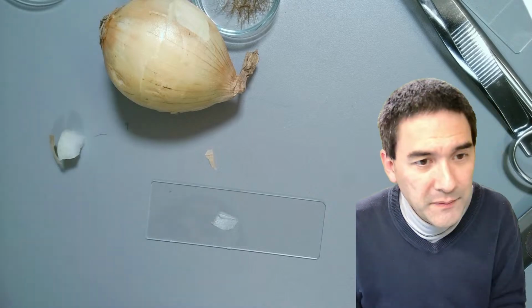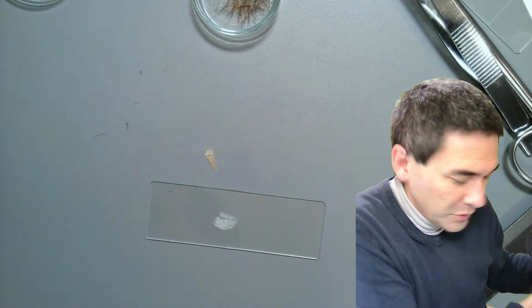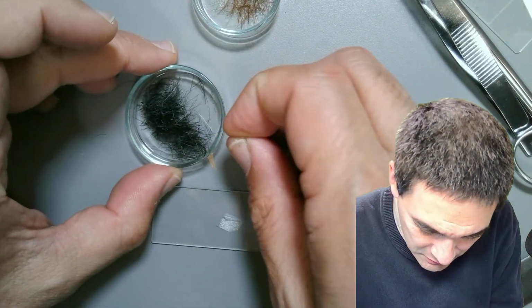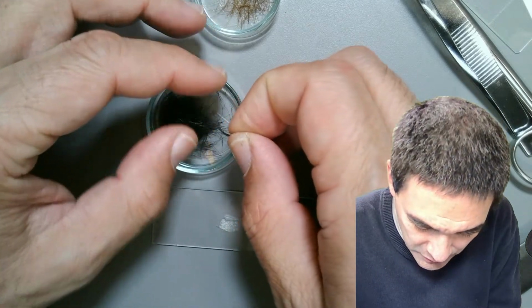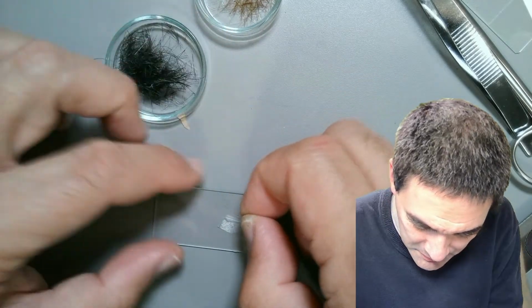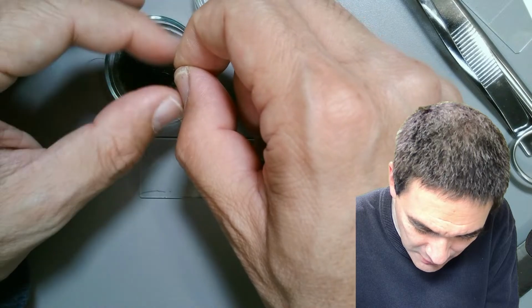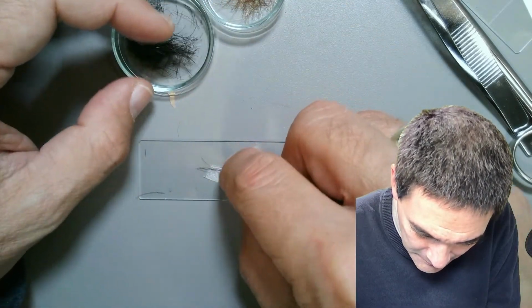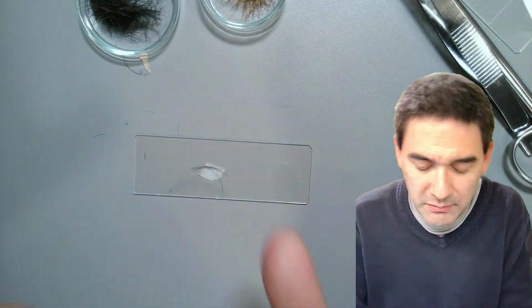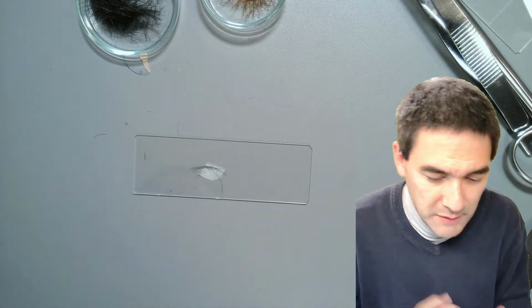No water yet. I'm going to put this away, because the whole room starts to smell like onions. And I'm going to put a little bit here, a few of my hairs, because that's one of the problems with microscopy or biology. Of course, we have all of these nanometers and micrometers and I don't know what, but sometimes it helps to make a direct comparison. Let's see how the diameter of a hair is in relation to the size of an onion cell. That's kind of the point.